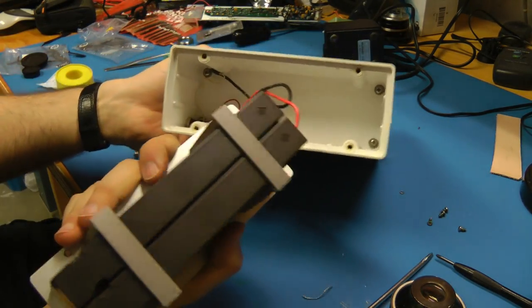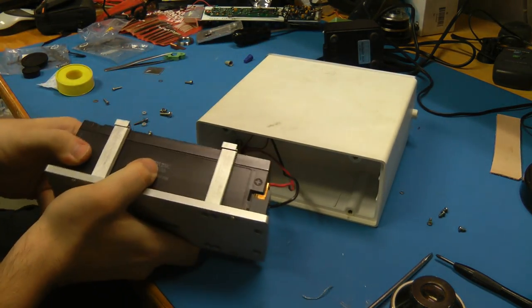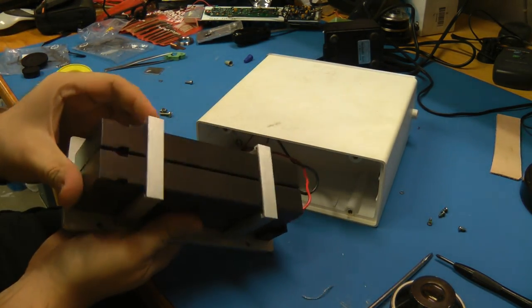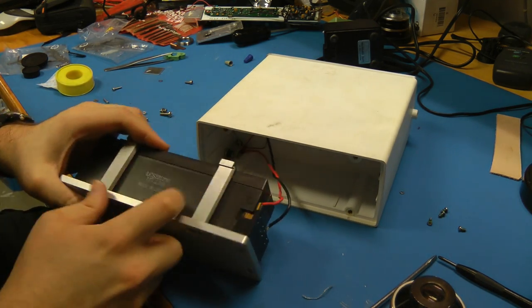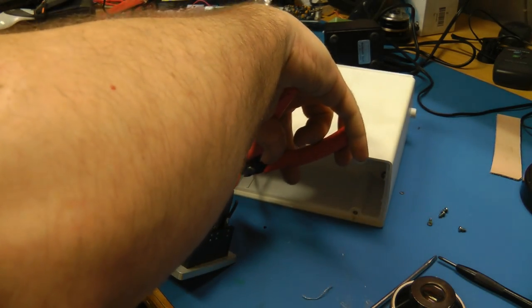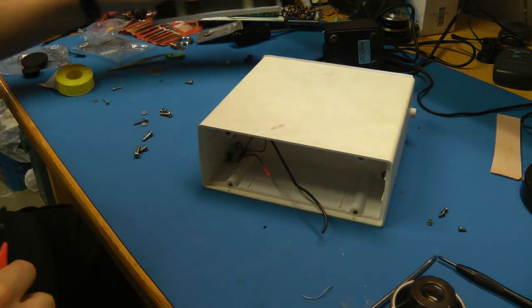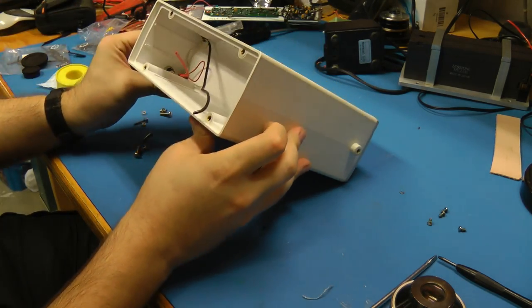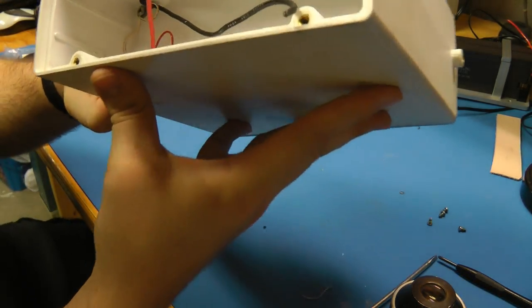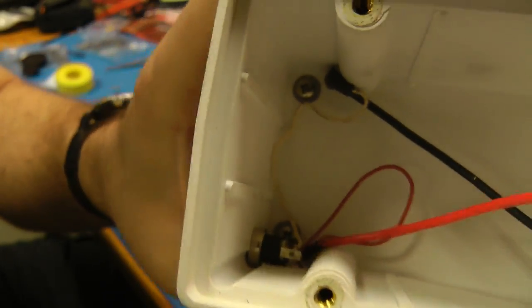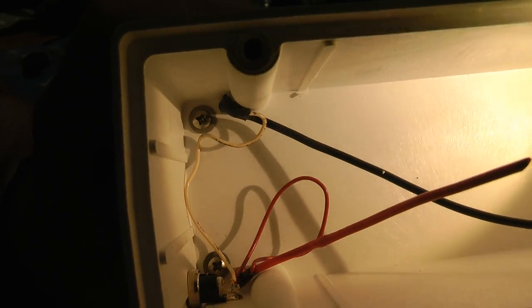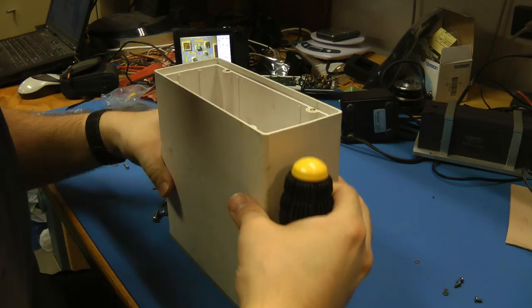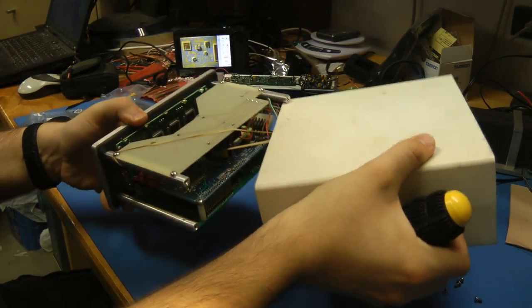Actually that's all that's in here is a couple of lead acid batteries. Of course those are going to be completely dead by this time. How do these come out? Oh, you take them out from the back. Doesn't really matter. Look at that. And yeah, it's just the power input which is like incredibly close. Like look at how tight that is. Let me see if I can get some light in there. That is just so tight in there.